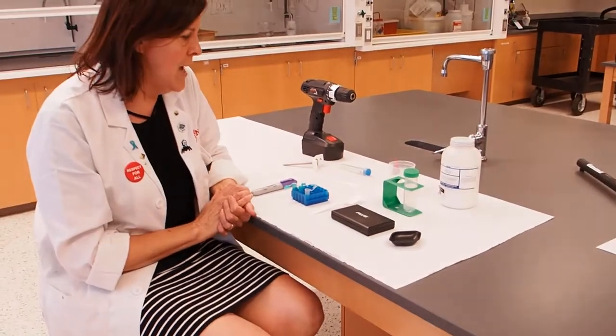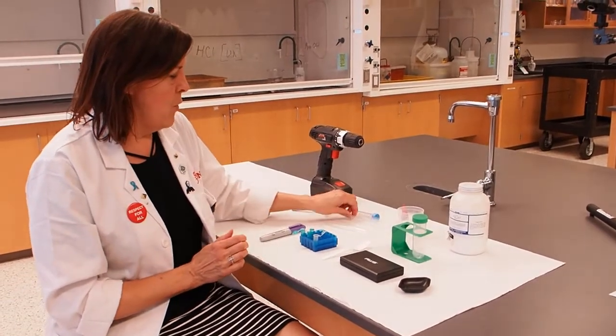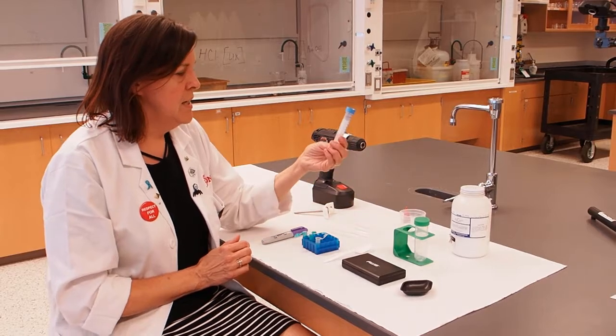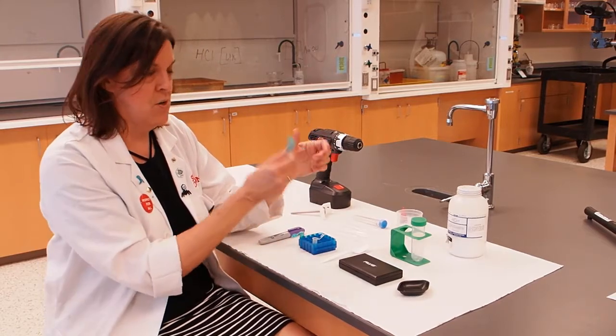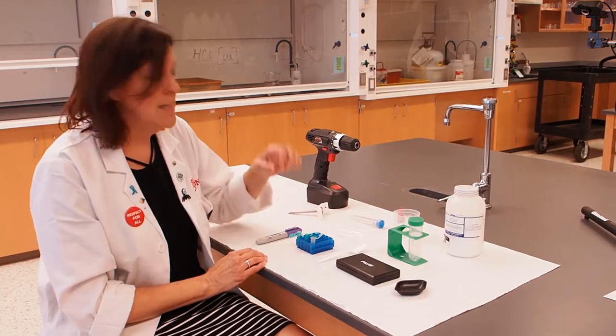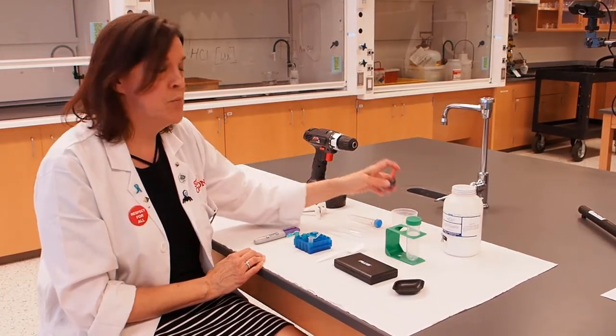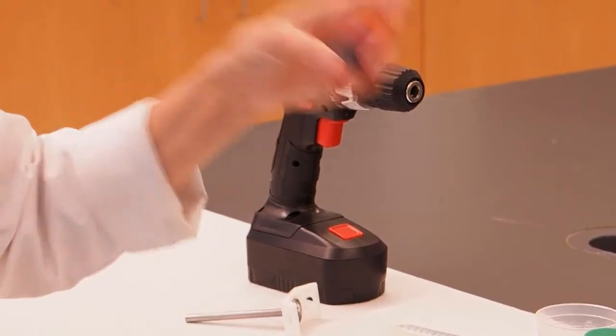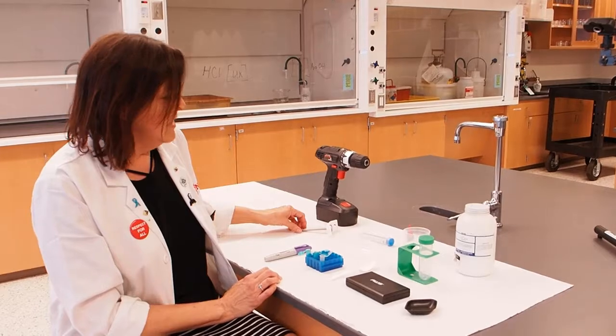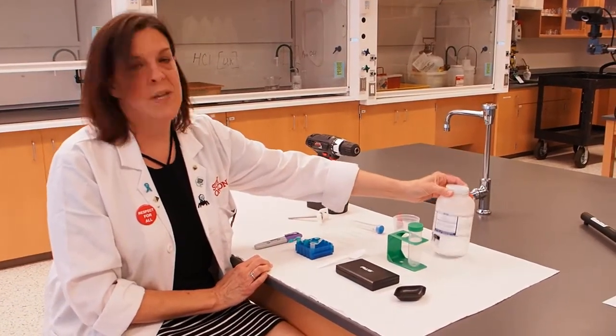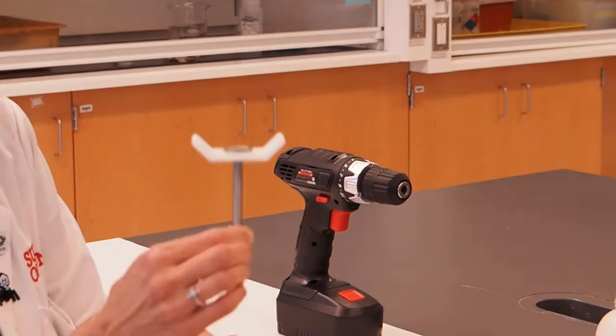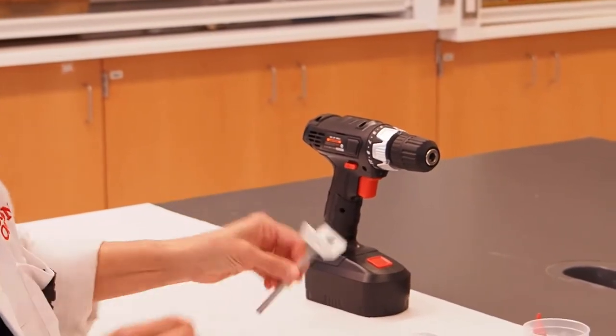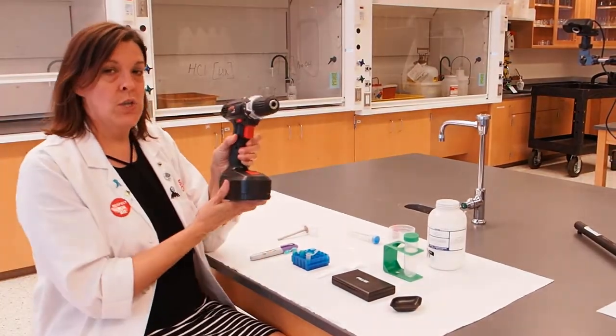From the activity number eight bag you're going to need four plastic pipettes, a vial of lemon juice, three microfuge tubes, the vial of blue dye. I'm not going to spoil the fun for you of this exercise and use the same dye as you will, so you'll be a little surprised by what happens. I'm using red food coloring instead of the blue dye today. You'll also have a test tube that has some skim milk powder in it and the adapter that is the sample holder for your centrifuge. You will also need a cordless electric drill.